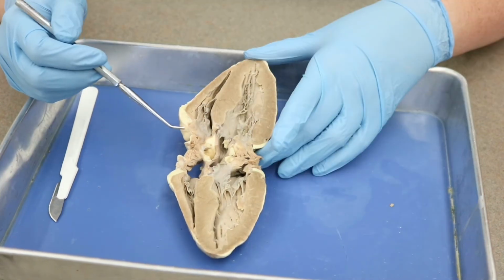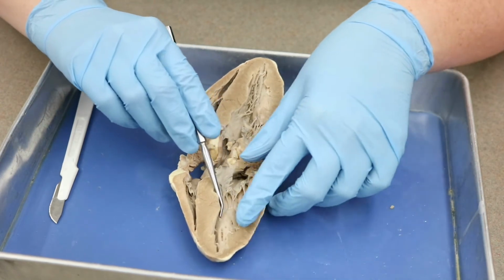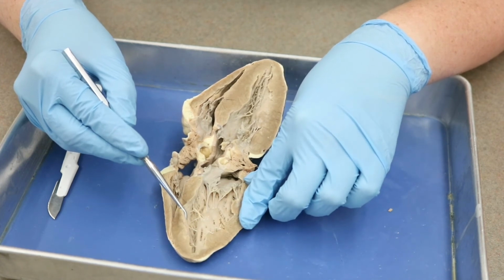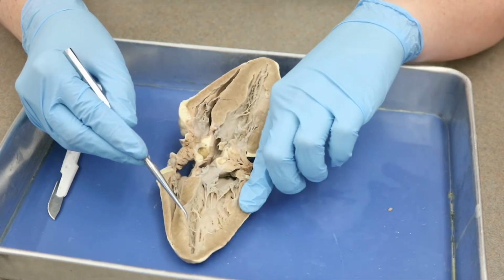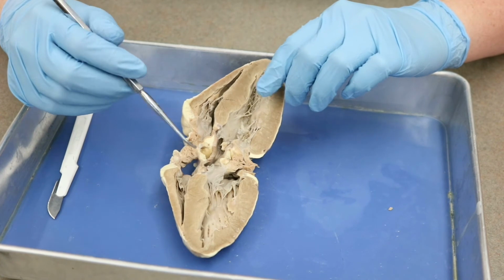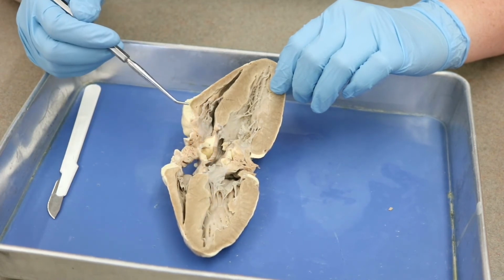All right, guys, so we just need to go back to two other terms that we didn't mention previously. So the first one is going to be our trabeculae carneae. So I'm going to go a little further down here, and you see here on the ventricular tissue that these are the papillary muscles up here, but there's all of this rough tissue around it. You can also see it up here. So there's rough tissue in here. So that is our trabeculae carneae. So trabeculae carneae, it just looks like rough tissue within the ventricles, okay?